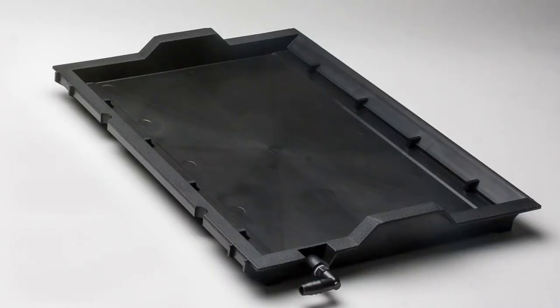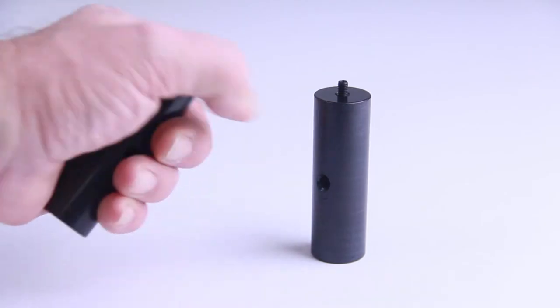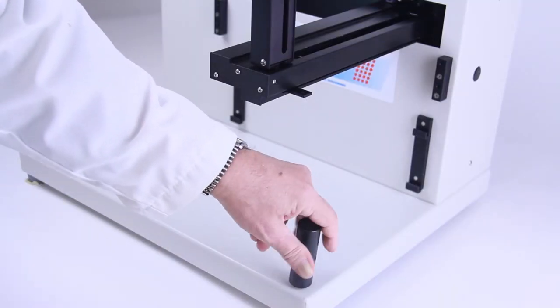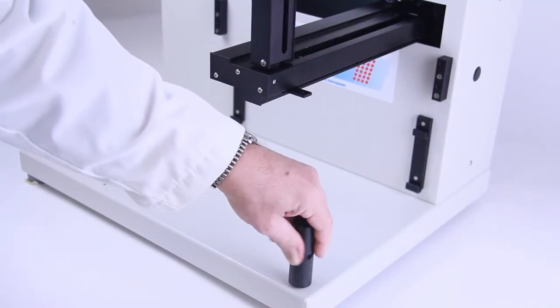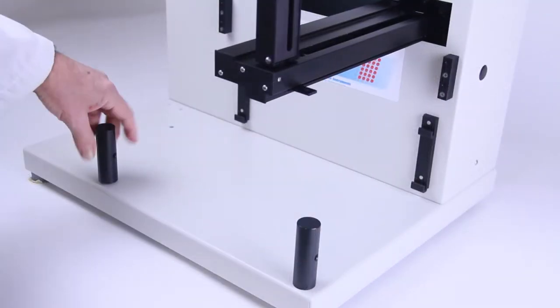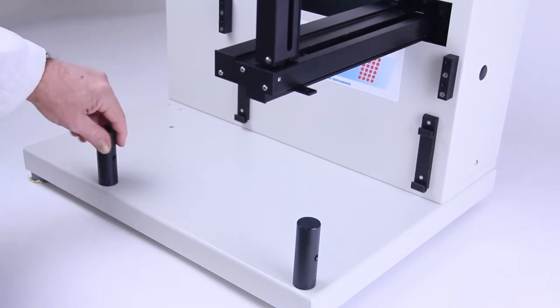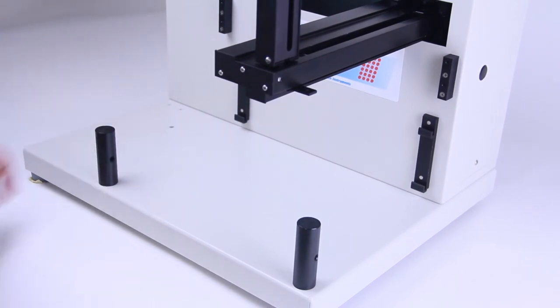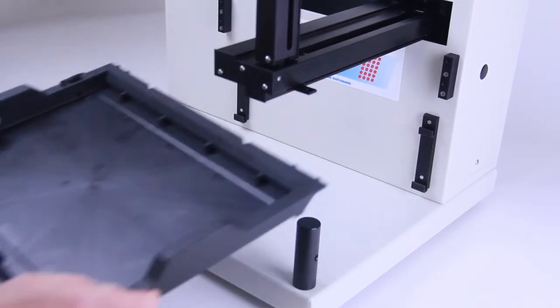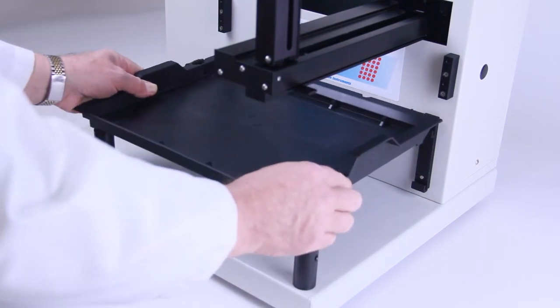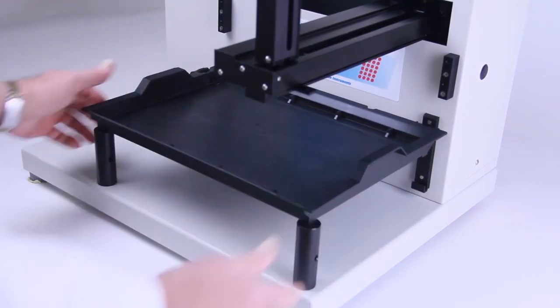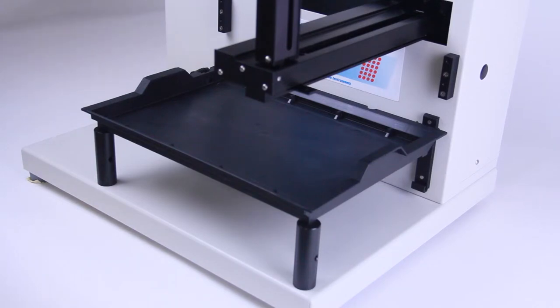Any liquid spills, such as those caused by the rinsing station and the overflowing of the well plate, may be contained within the tray. First, screw the tray support post into place. Place the tray on top of the support post, making sure it fits securely in the tray mounting brackets and that the drain outlet is located on the left rear of the tray.